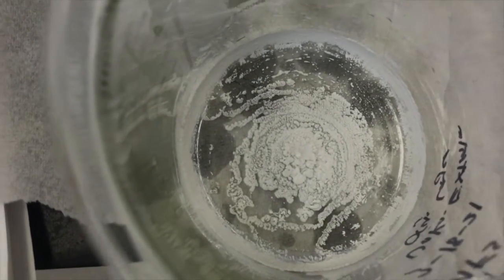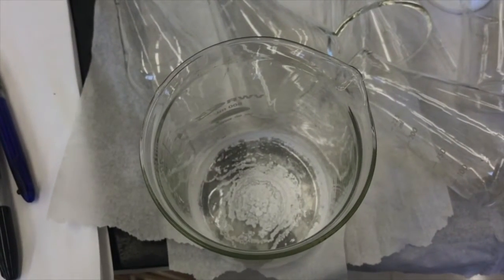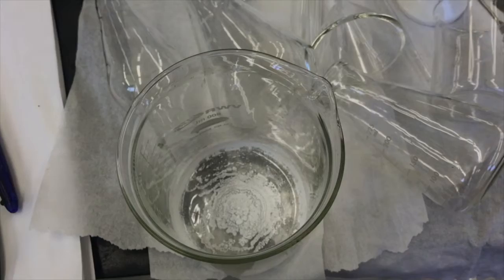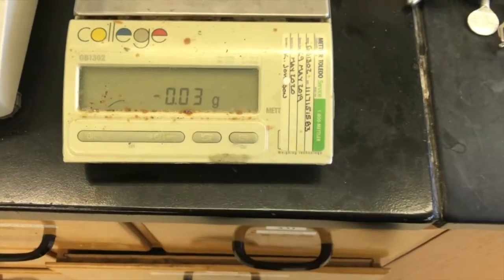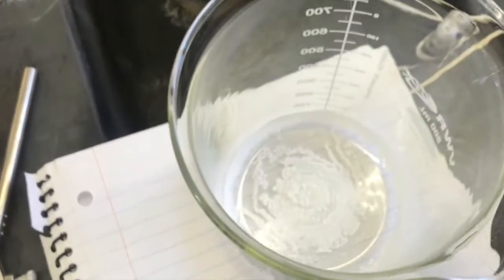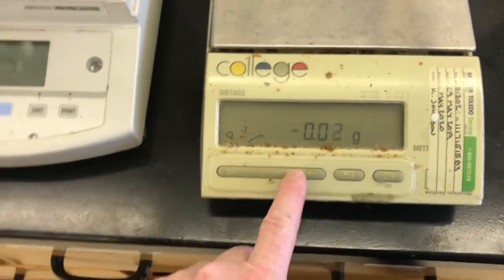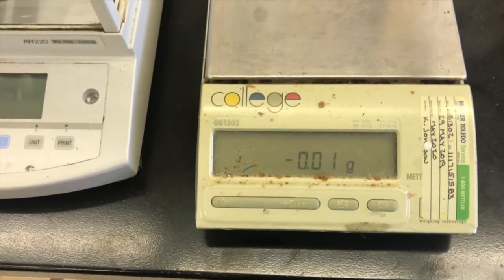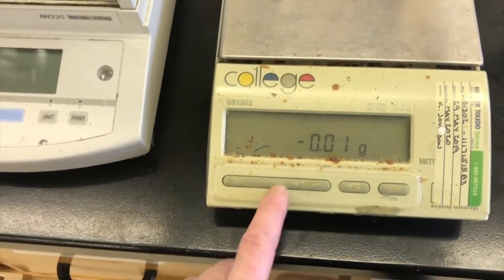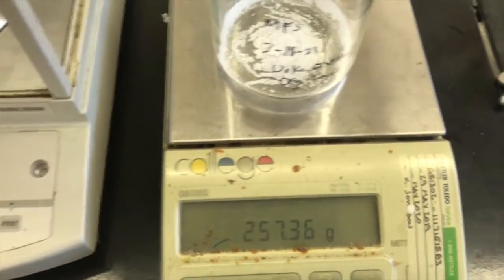Pretty looking, huh? So initially what I'll do is I'll weigh this. I'm going to dry the bottom of it with a paper towel, since it was nested in that water bath. So let me pause the video for that. I'll record the mass of this beaker and the two solids in there on the same scale I used before, the top loading balance, but first I'll zero it. Looks pretty good. I'll do it one more time. Okay, close enough. So I'll put this on there and let's see what it comes out to be.